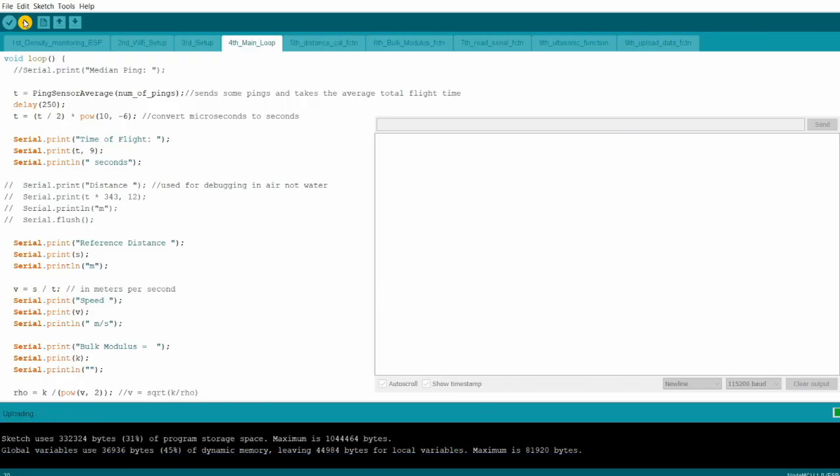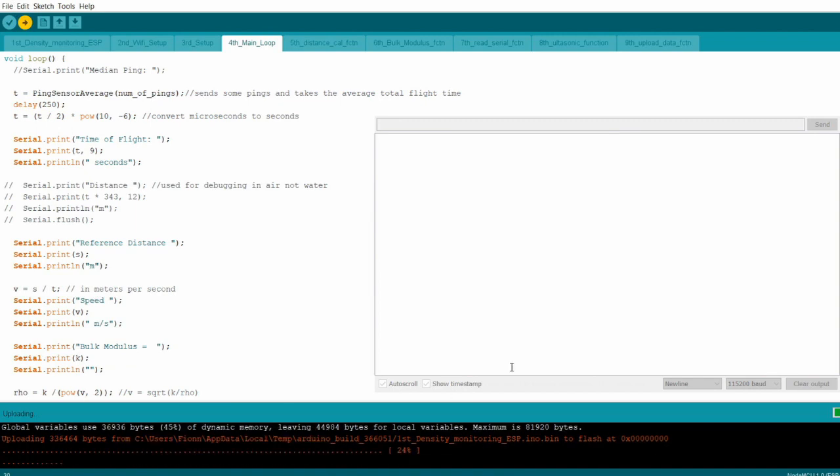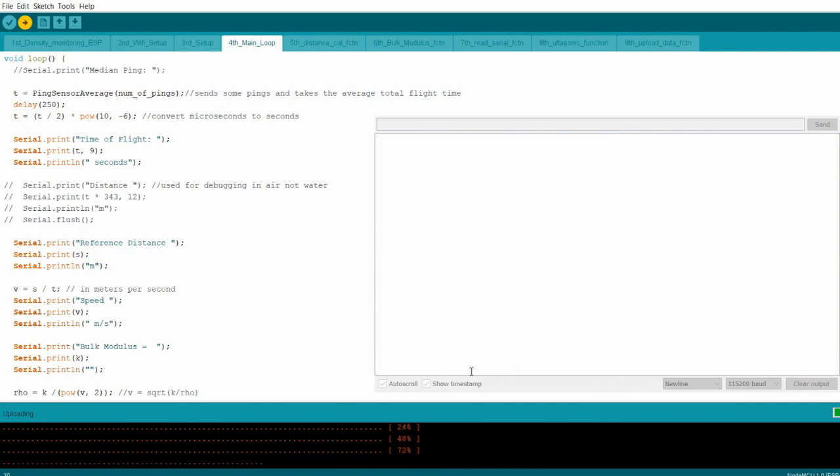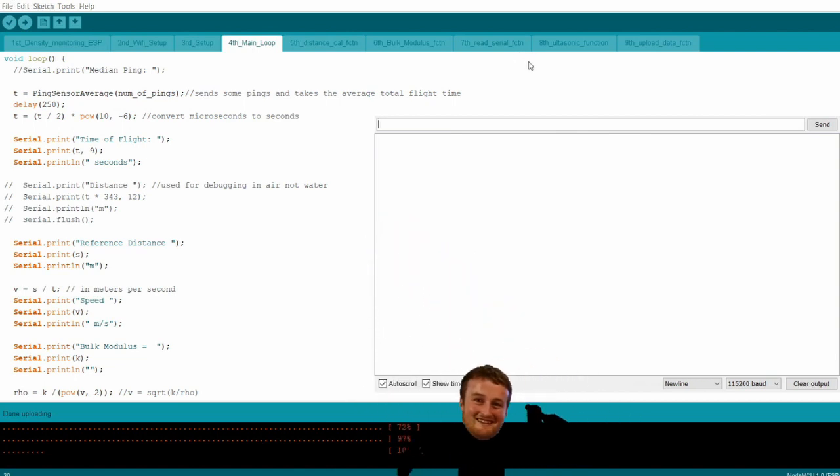So here we have the program. This is just uploading to the ESP as we speak. There were a few issues with this. I was at this for a couple hours after that last clip, but it's working like 95%. I know there's a few other issues, but to be honest, the fumes from the buckets were starting to get to me, so we'll leave it at this and we'll come back to it at a later point.